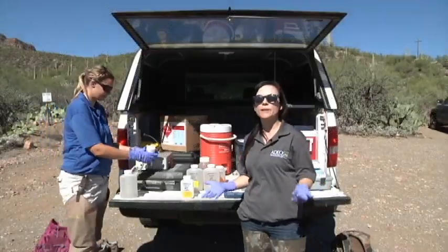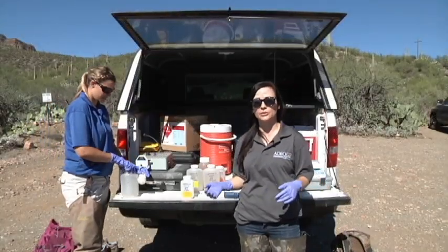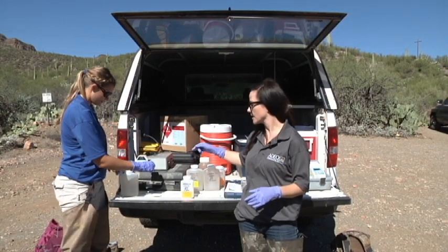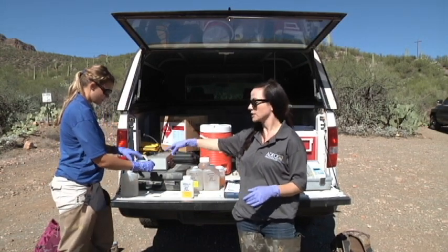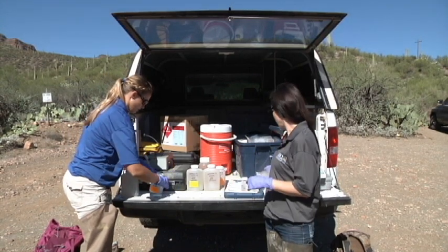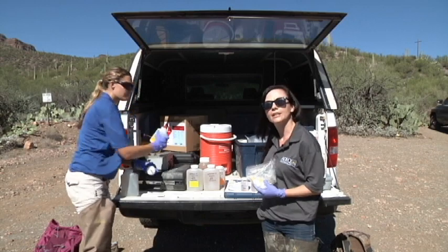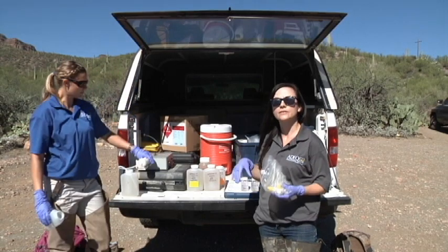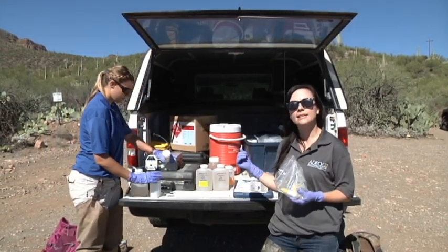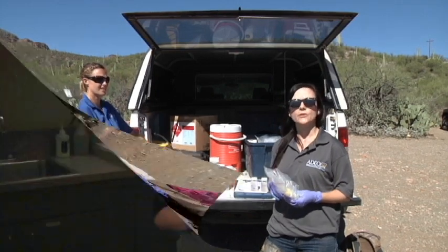After we sample, when we get back to the truck, we have a few more things to complete our sampling trip. We filter for dissolved metals using a tube and a large filter that takes out all the sediment. Then we add preservatives like sulfuric acid and nitric acid to preserve the samples and keep their integrity until we get them to the lab. We put them on ice and get them to the lab within 24 hours.